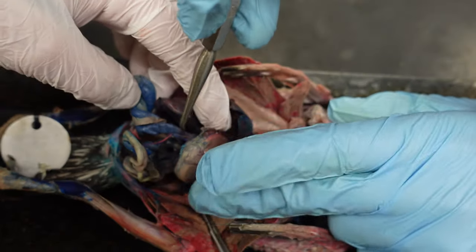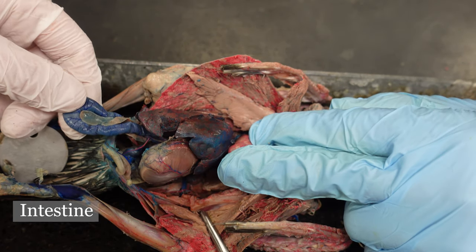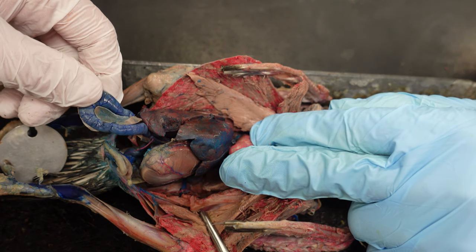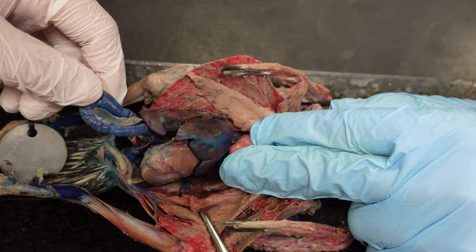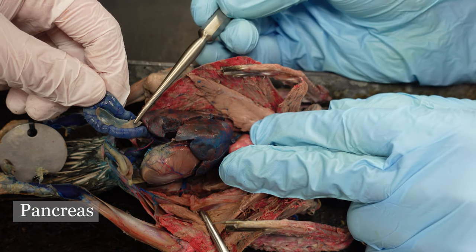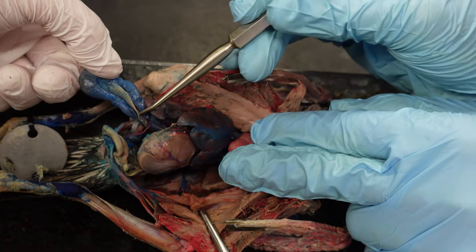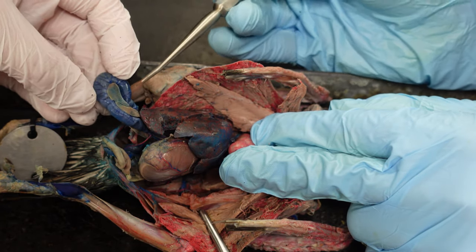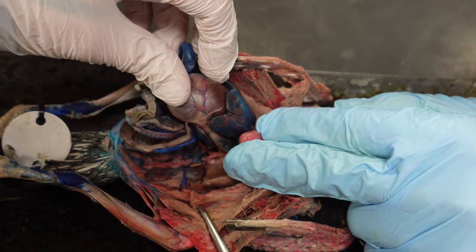The gizzard empties out into the intestine. We're not going to go into much more detail — they have a large and small intestine, but we can't necessarily see the distinction between them. And then we have the pancreas, which has two lobes similar to the shark: a dorsal and a ventral lobe, as it kind of fits in between some of those loops of the intestine.